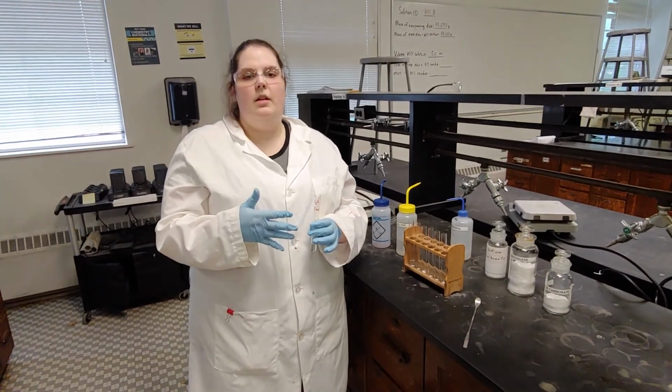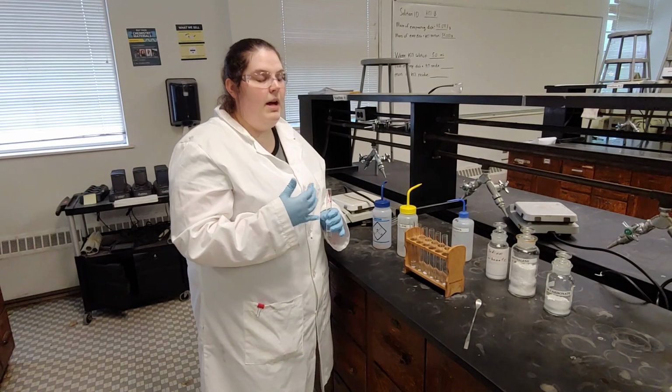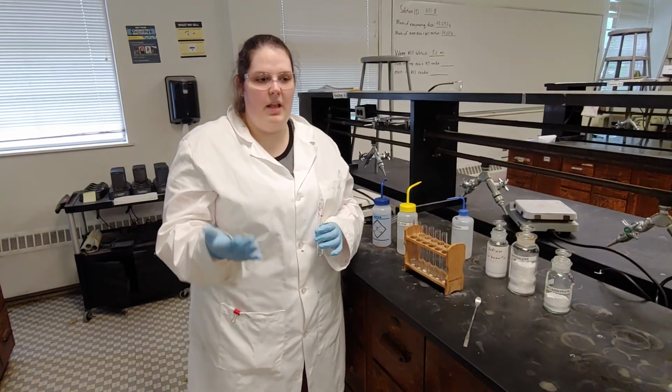And then I'm going to put parafilm on the tops of the test tubes so that I can shake them.